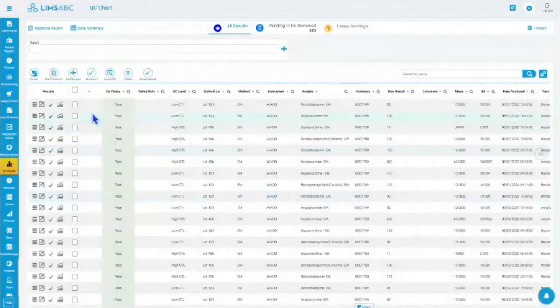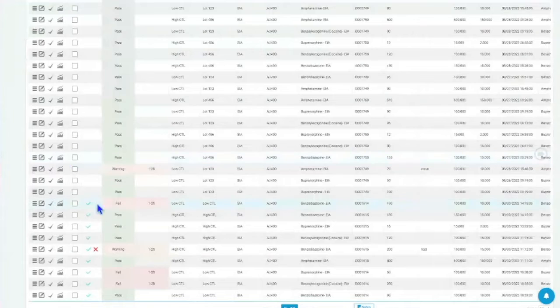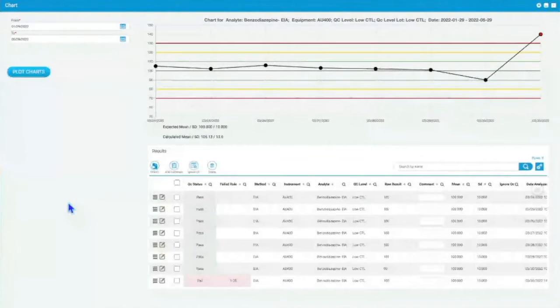So you can easily select them. Let's say you looked at these are my AU 400, these are my QCs, my lots, everything looks fine. I can just say that I've reviewed them. So the next person, or I, know that I don't need to look at these results. And I can see what happens. So let's say I take this one that failed. I can look at the Levey-Jennings chart, and I can see the chart, and I can see why it failed. Obviously, this one failed because it is way up high there above my 2 standard deviation, above my 3 standard deviation actually. So you can see this failure.